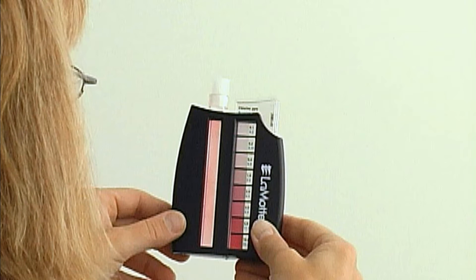Don't face directly into the sun. For the most effortless color matching, hold the comparator above the horizon or toward a plain backdrop to eliminate busy and colored backgrounds.